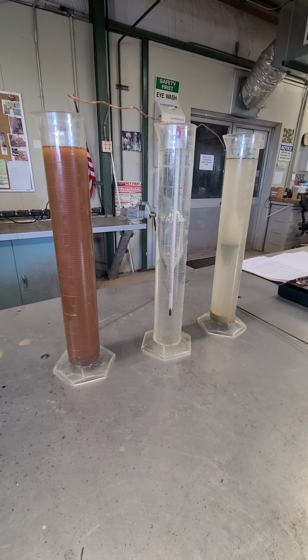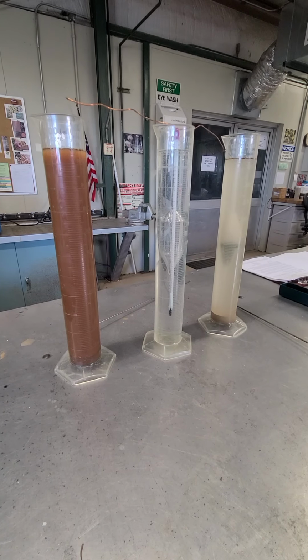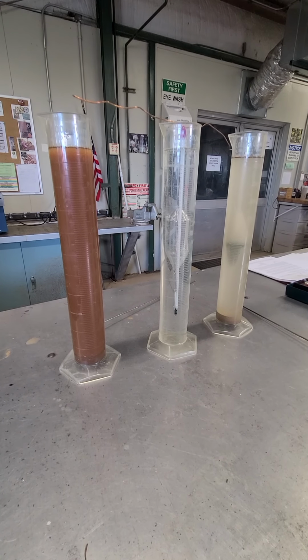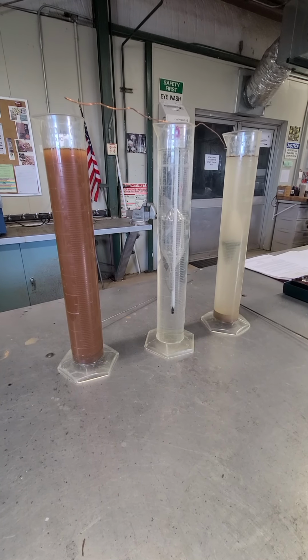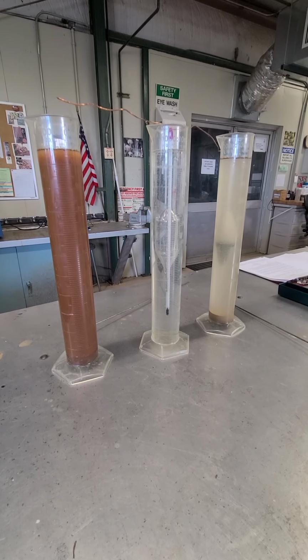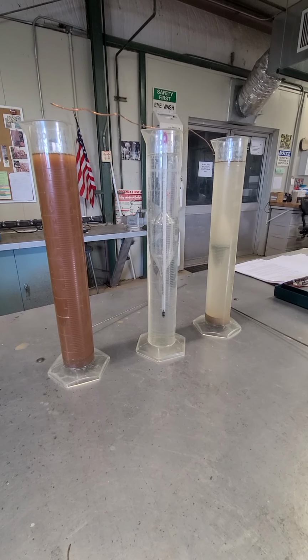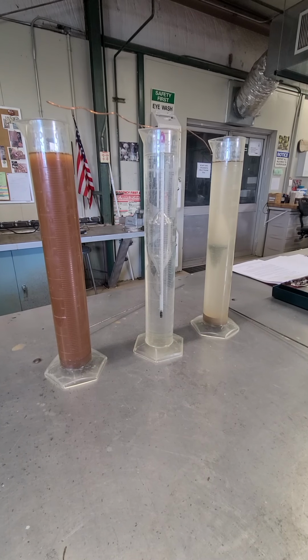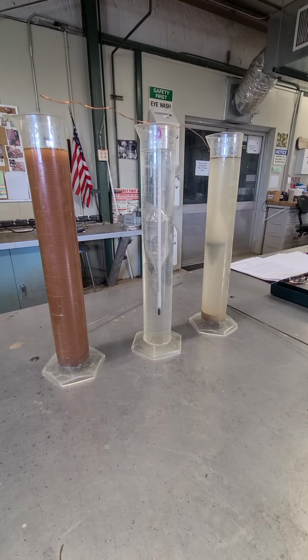because we've really got something that's completely cleared out, which means that there's really very little clay in this, because the only thing that's going to remain in suspension after 3 hours is clay. So clay, if we've dispersed it properly with our HMP, is too light to actually settle out of solution. So a properly dispersed clay will actually remain in solution pretty much forever. It really will not ever settle.